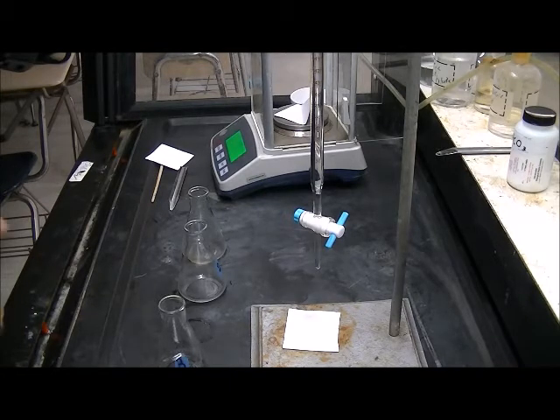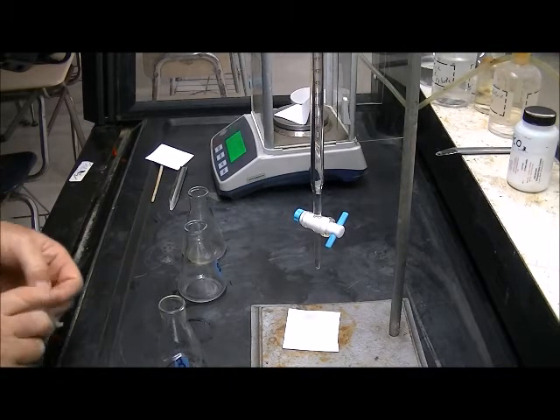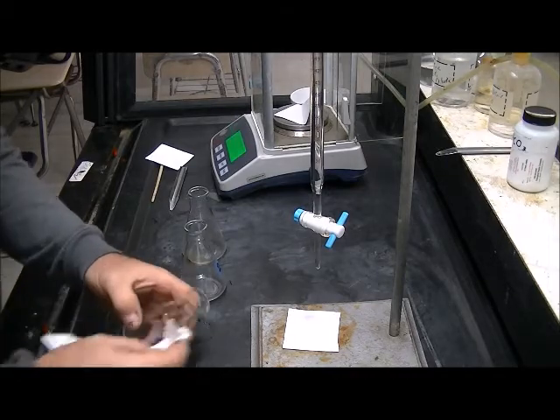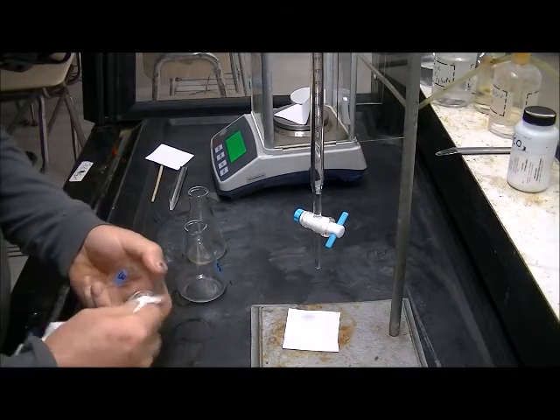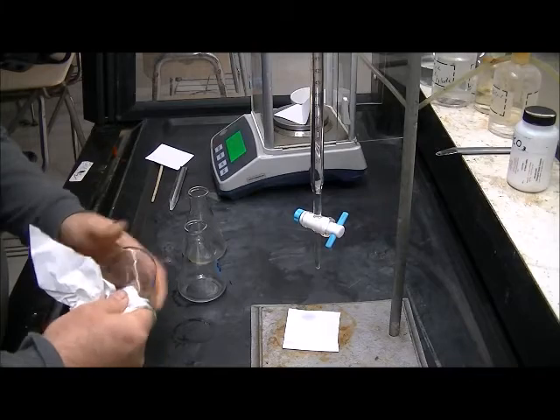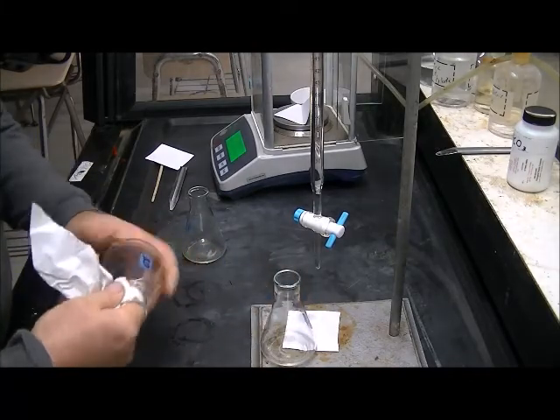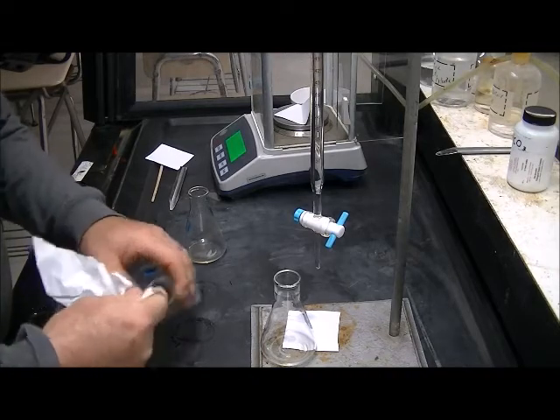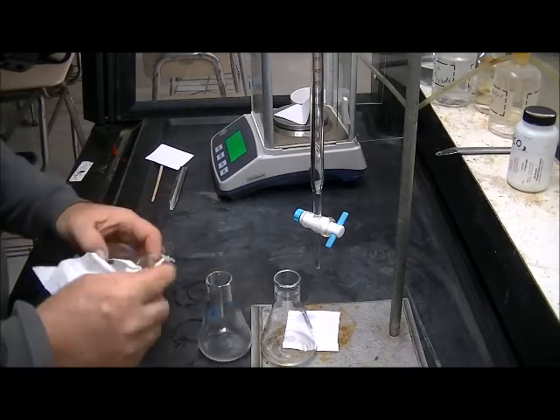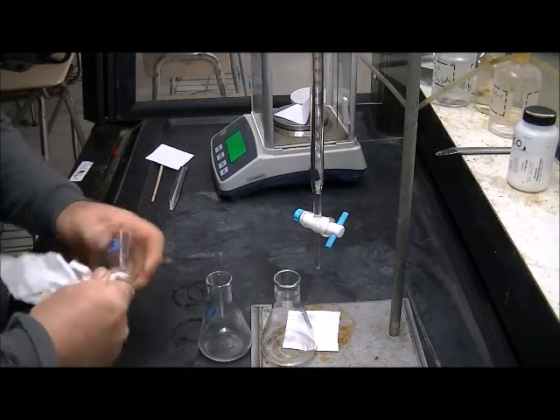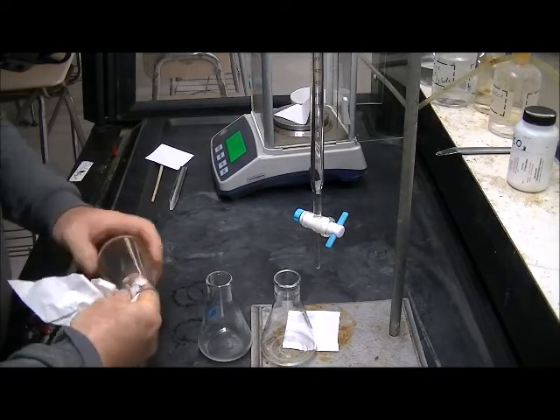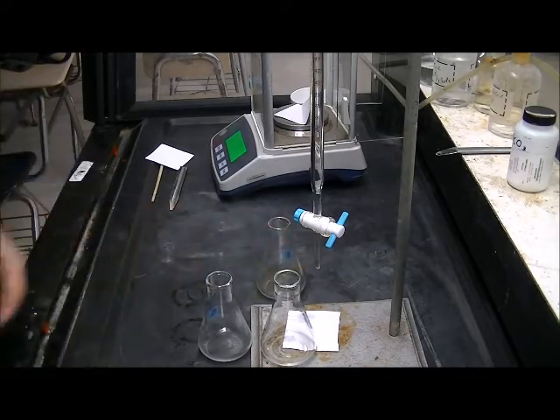I have been dumping these flasks in the sink and rinsing them with distilled water. And then I want to just dry the inside of the neck. So when I add the new sample to them, it doesn't stick. I want it to drop down to the bottom of the flask rather than stick to the side of the neck. So I'm drying those necks in between samples before I refill them.